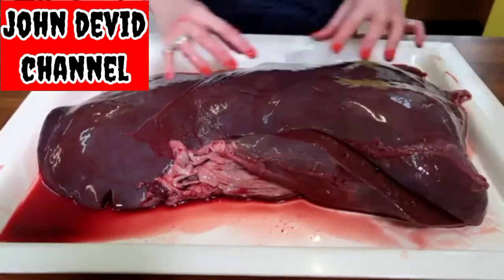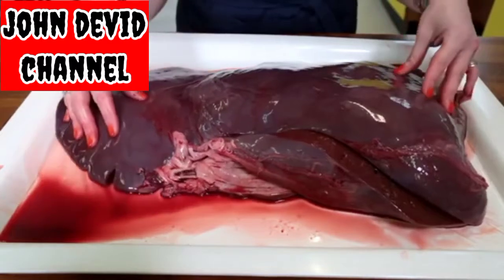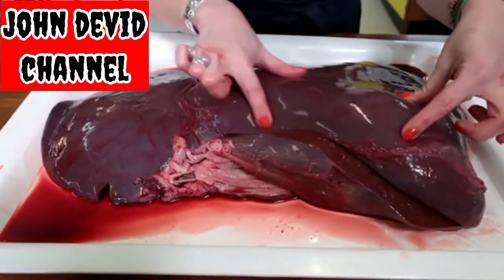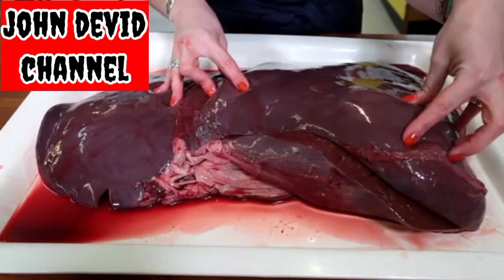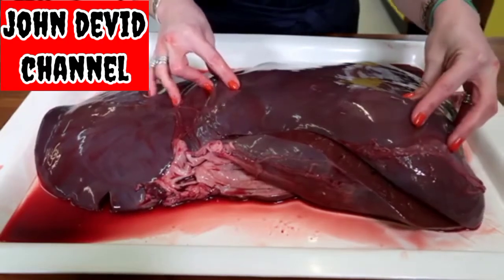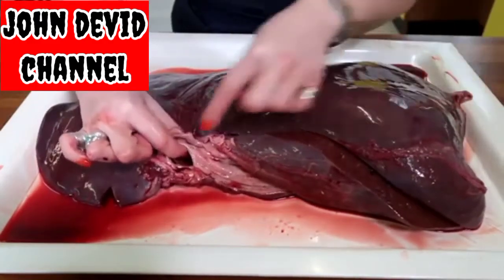So the liver is made up of two lobes, a largest right lobe and then a slightly smaller left lobe. And the darkish reddish colour is made of all the cells which we call hepatocytes. And the function of these is to remove harmful toxins from the blood. In order for the blood to go through the liver, we have two main vessels.